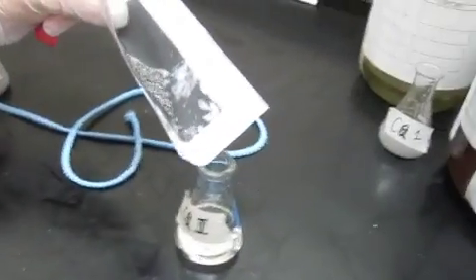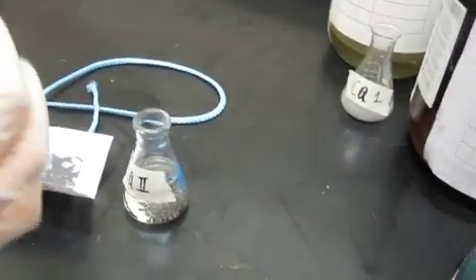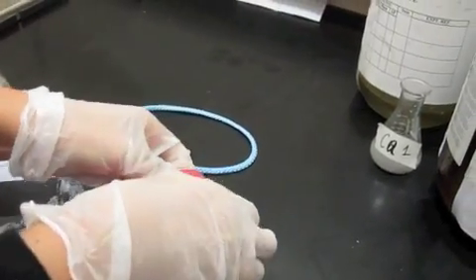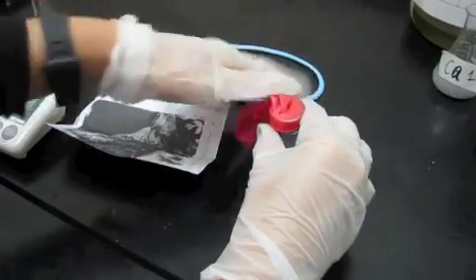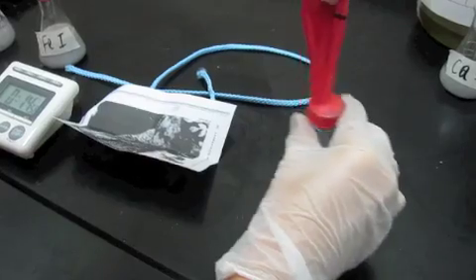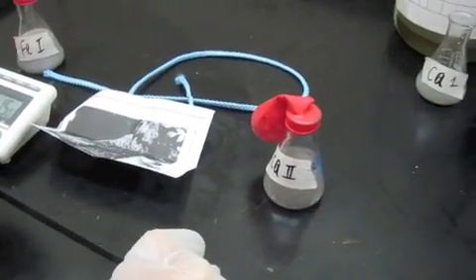We started our first trial by pouring calcium pellets into the sulfuric acid in the small Erlenmeyer flask. However, after trying it for all 3 trials, the calcium balloon did not seem to blow up. This was probably due to the size of the pellets. Powder is better in reactions because the H2SO4 has more surface area to react with the metal powder.